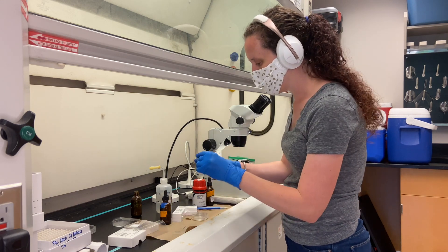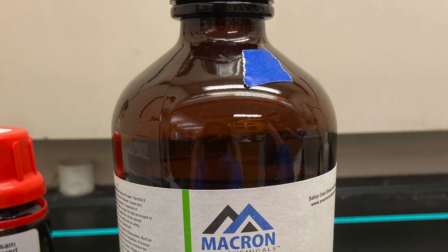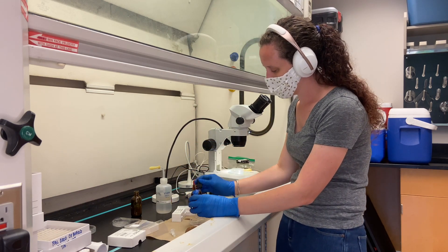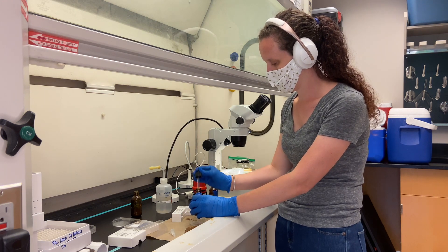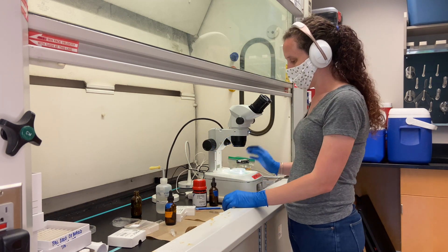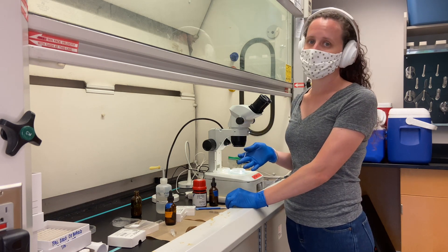I've labeled a slide with a specimen number and all the information on the parasite label. I'm going to put a little bit of xylene in a small dish — xylene is the clearing agent. You put parasite specimens into it before you mount and it clears them, making them transparent so you can see all the way through them. This is toxic — do not get it on your skin, do not breathe it in — this is why we're doing this in the hood. While you can reuse xylene, sometimes it's better to do the clearing in fresh xylene because the specimens don't float. When you move the specimens from ethanol into xylene, sometimes they can float. Make sure you push the specimens down because if they float they get air bubbles inside that turn the specimen black and you can no longer see any morphology.